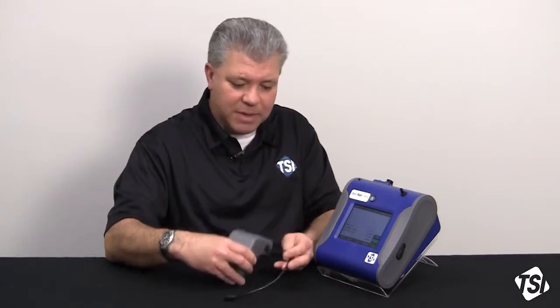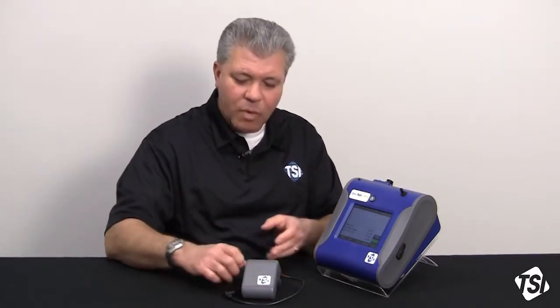A couple of things to keep in mind. For a 24-hour sample, people will typically set their Auto Zero module frequency at, say, 2 hours, 3 hours, 4 hours, sometimes 6 hours, so that you're zeroing fairly regularly during the day.